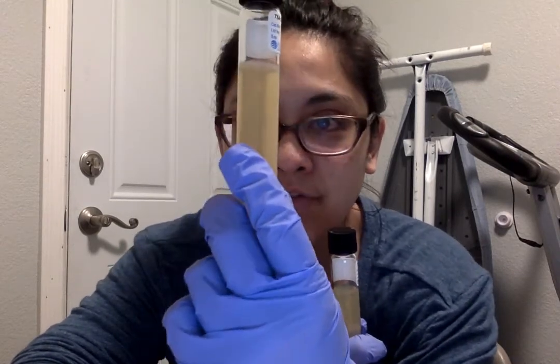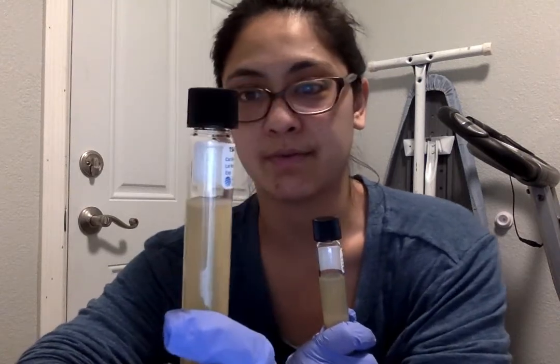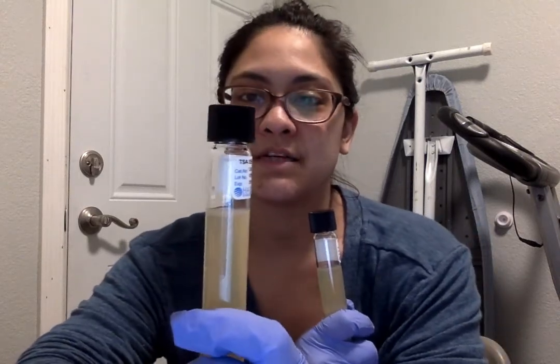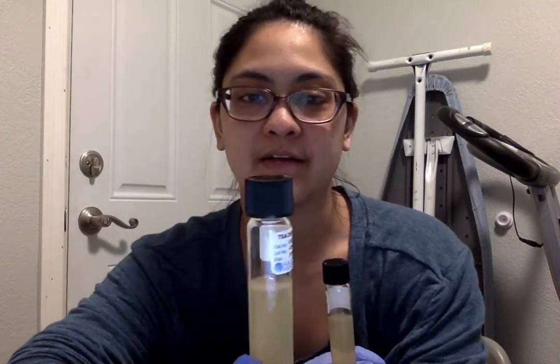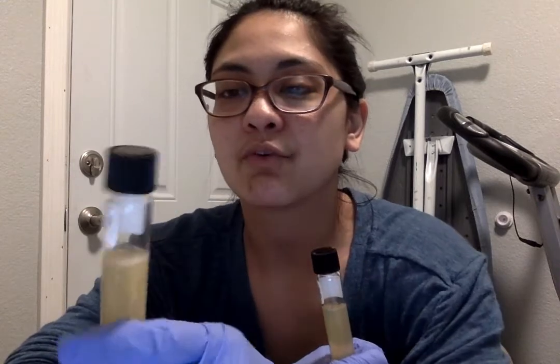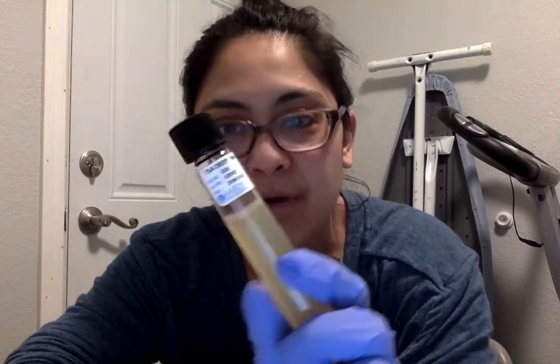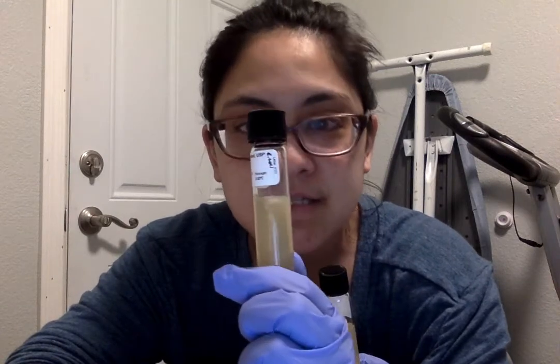And then I have growth all the way, probably about another 1/4 of an inch down through it, and not just in what would appear to be the spiral of what was inserted, but on its own it moved, and that was with the E. coli. Of course, on the top there was quite a bit of growth. I wasn't surprised by that. I thought it was expected.